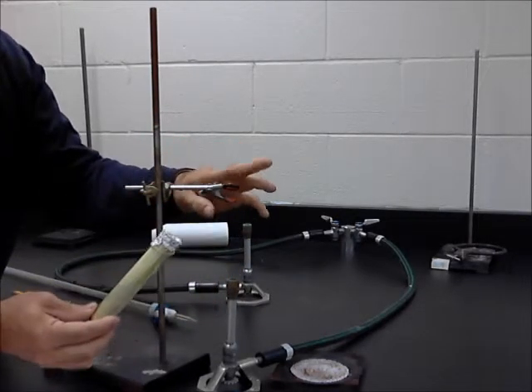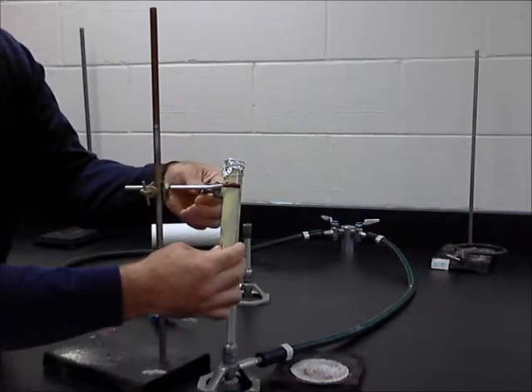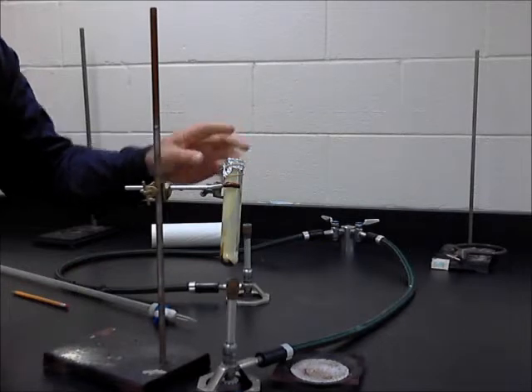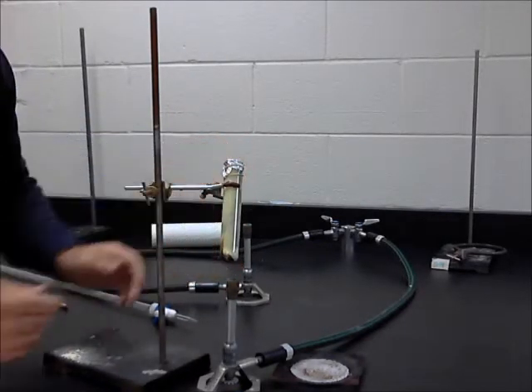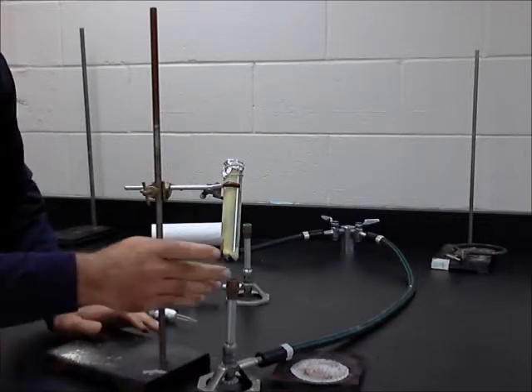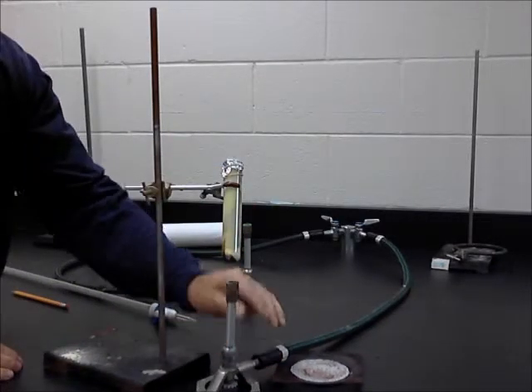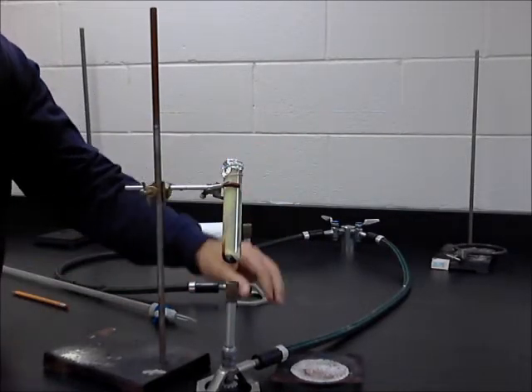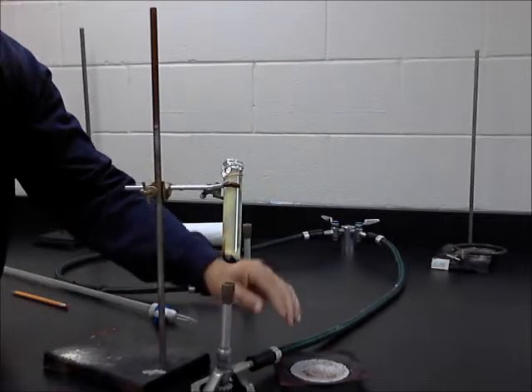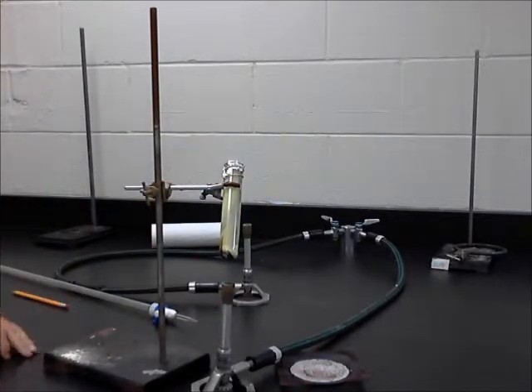We don't want to burn this thing, so I'll clamp it close to the top of the test tube. Swing the butt end of the test tube out so that when the flame comes up, it's hard to tell from the angle of the camera, but I don't want the flame to touch the finger, so I'm going to get it a little more towards you. Alright, and here we go. Alright, so the next thing is just to turn on the Bunsen burner.